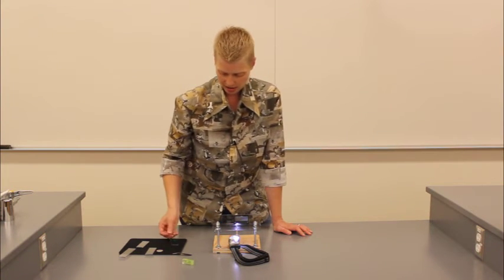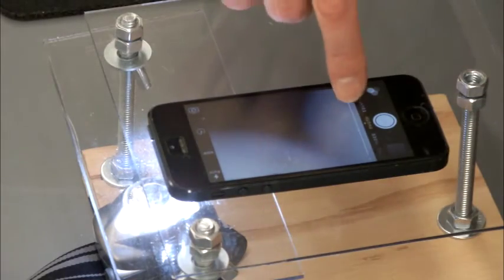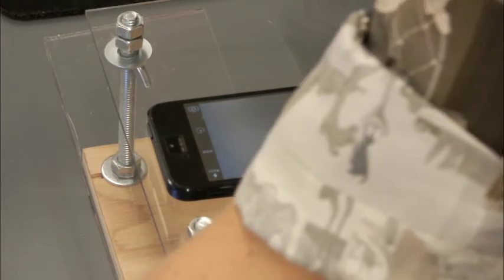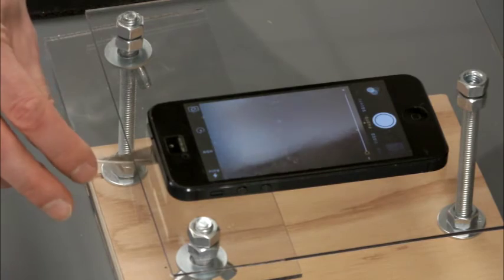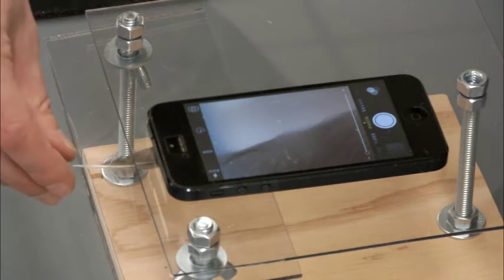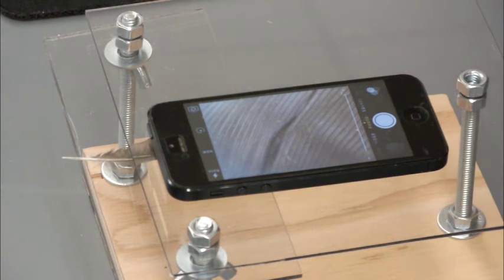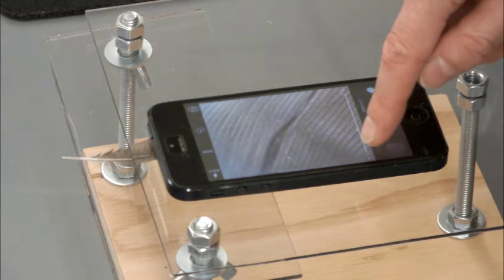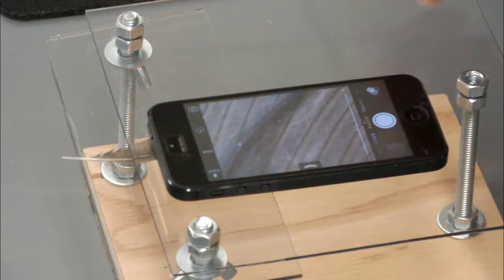Let's take a look at a feather. So for the feather, we'll take the light out. You can see the detail of the feather, the individual pieces that are making up the feather, and we can zoom in on that as well. So there's a feather.